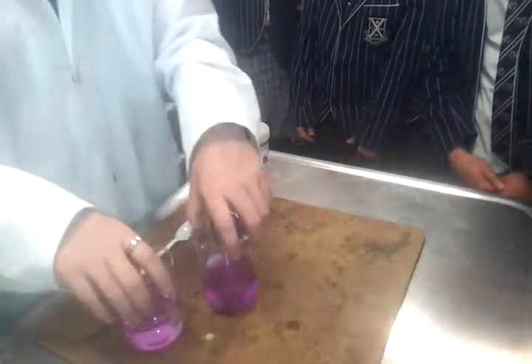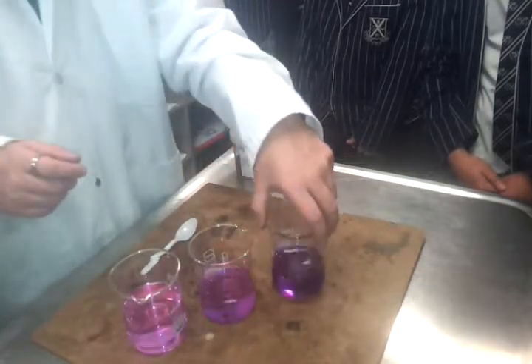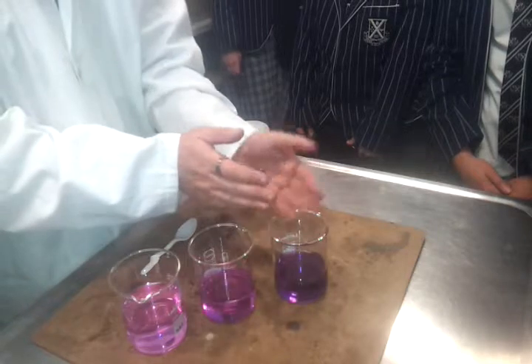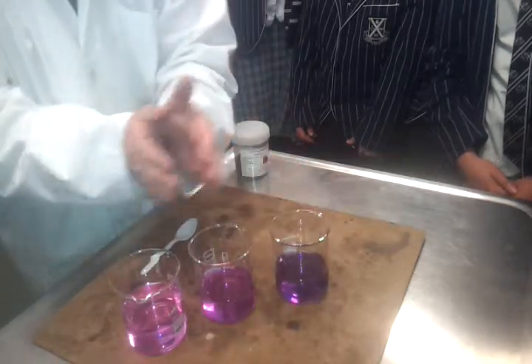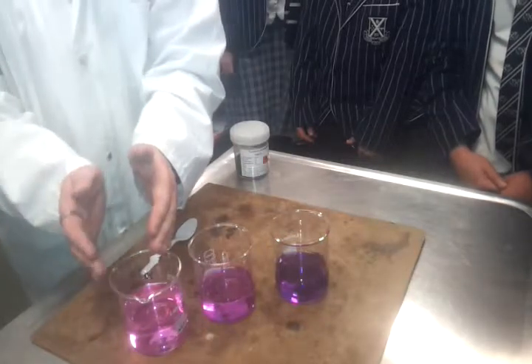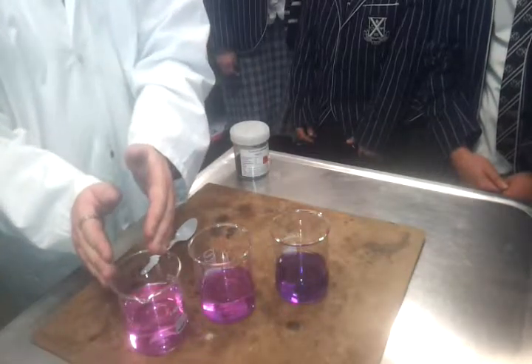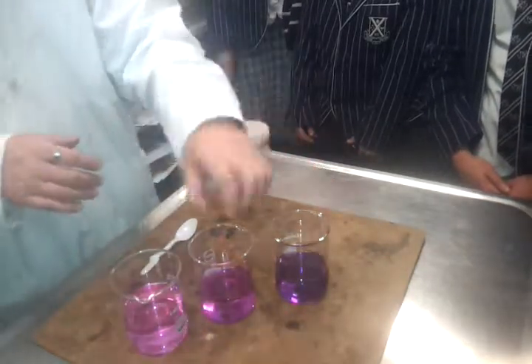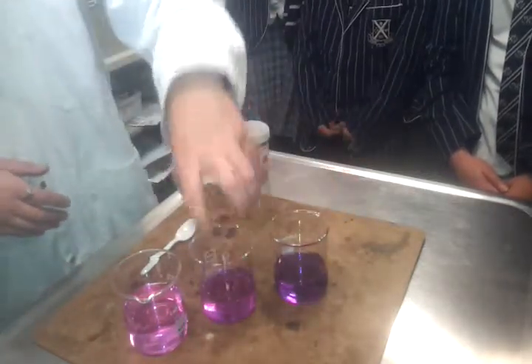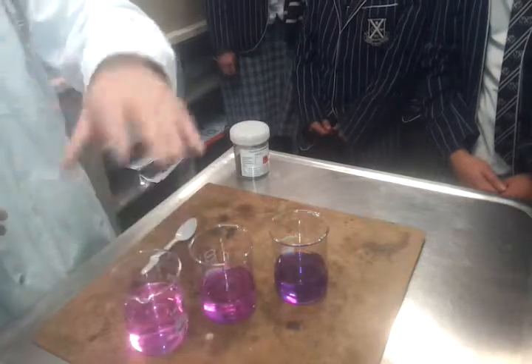So just a reminder, and we'll get this on the video so that you can all see it again when you're doing your revision. The darker colour has more particles for a given volume, so it's more concentrated, and the lighter one has got fewer particles for each millilitre, so it's more dilute. We'll be able to make it by making a concentrated one and just adding some of it into water and taking that and adding it to some water and so on.